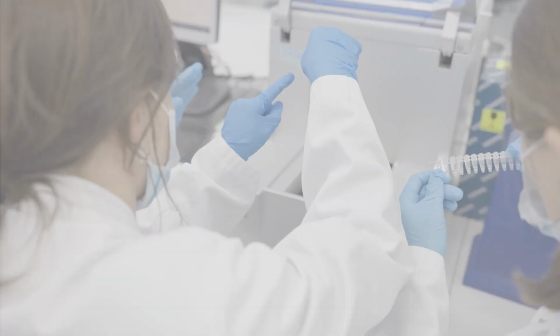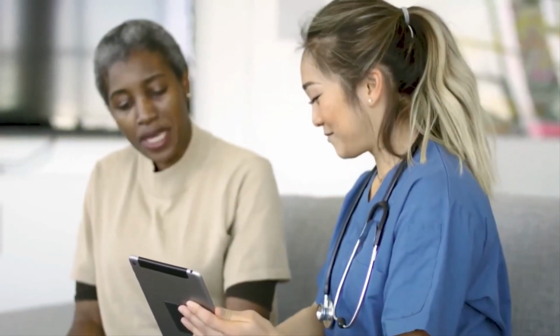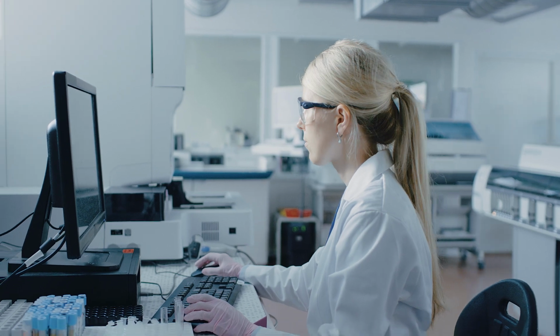In this video, we'll explore how HGMD addresses the complexities and hurdles scientists and clinicians encounter in creating accurate and comprehensive panels for germline mutations, and demonstrate how HGMD can save you time when doing just that.